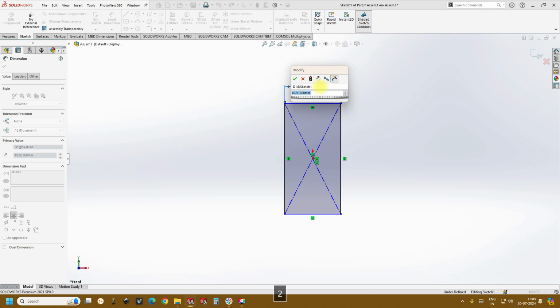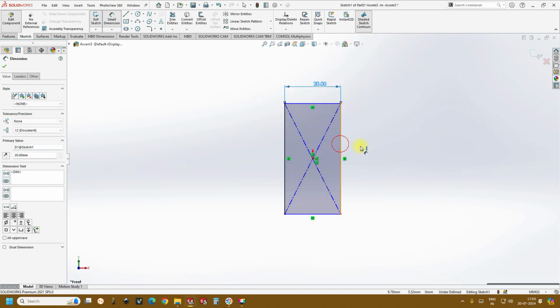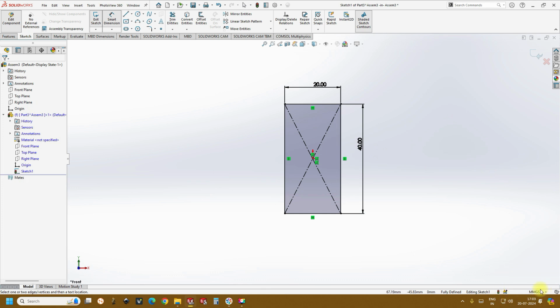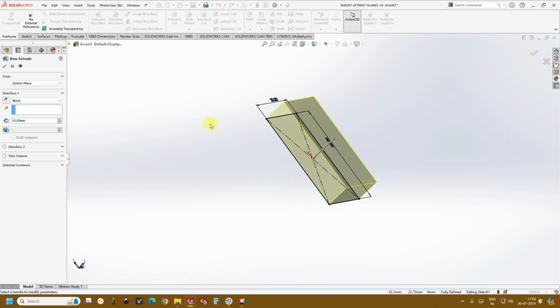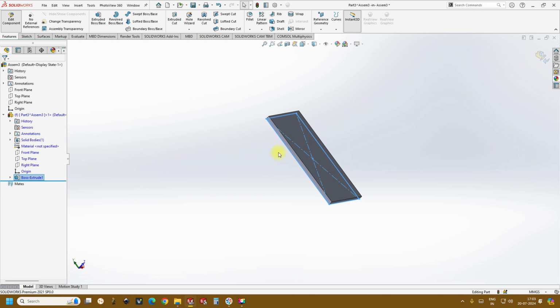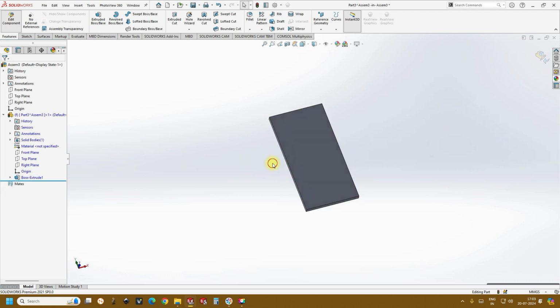Also I prefer 20 cross 40 mm, and if you want to change the units, here you can change the units, like mm. So in this position you can change the units, and go to features, extrude boss, create a height of 1.5 mm, and it again changes based on the application or the requirement.